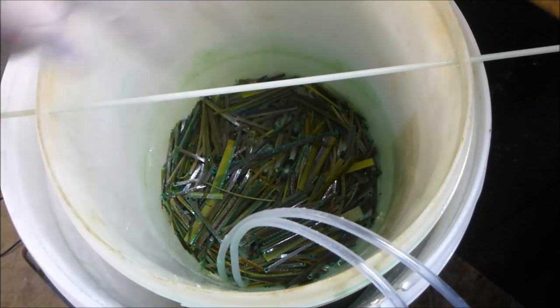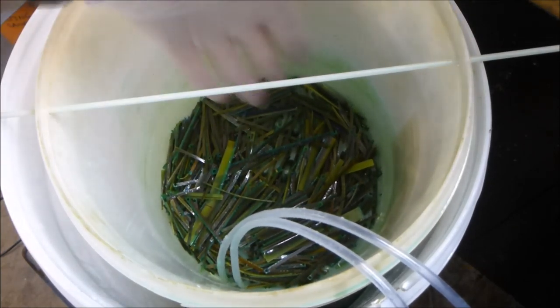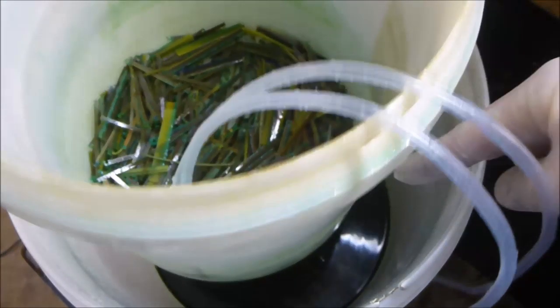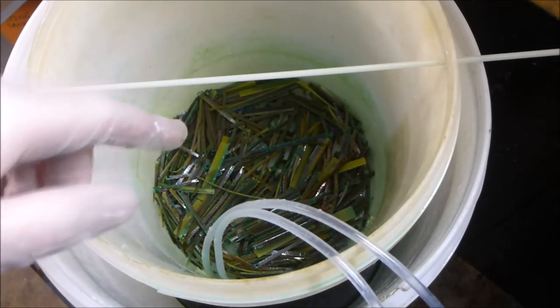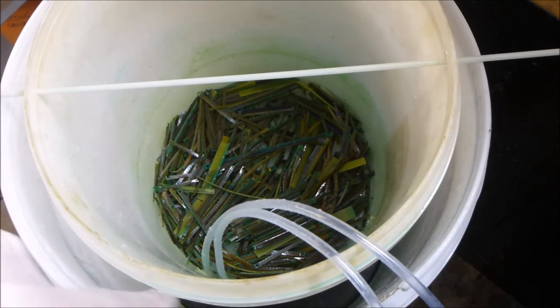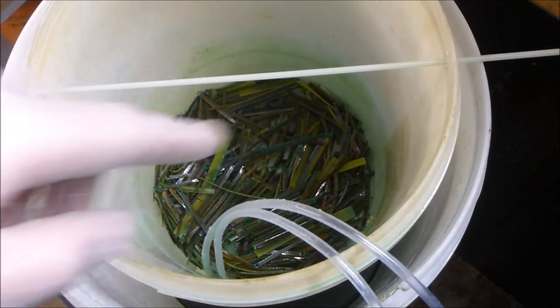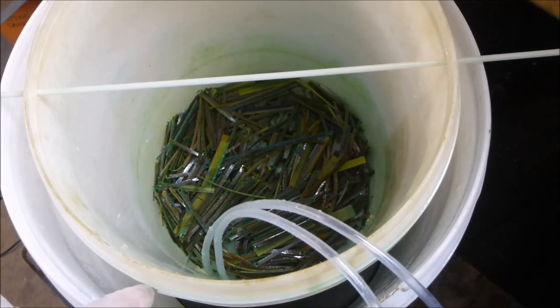using the AP process, you end up dislodging most of the foils from your fingers, which then end up down there in your acid peroxide solution or your copper chloride leach. And those of you familiar with the process will know that one of the biggest pains is actually to filter that leach to recover all the small particles of gold from that.